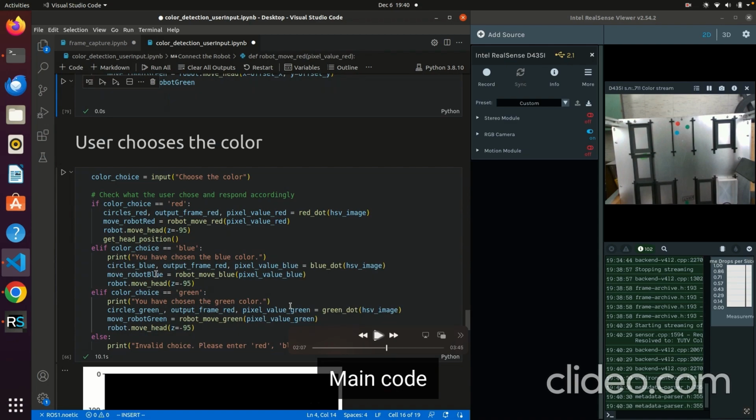You extract the blue image, and then you also display the frame, and you get the pixel value. Same for green. You get the green circles in the image, you get the output frame, and you get the pixel value from this function. You're extracting this return from this function to these three variables. Move the green, go down z. If it's not red, blue, or green, you will just simply say it's an invalid choice.